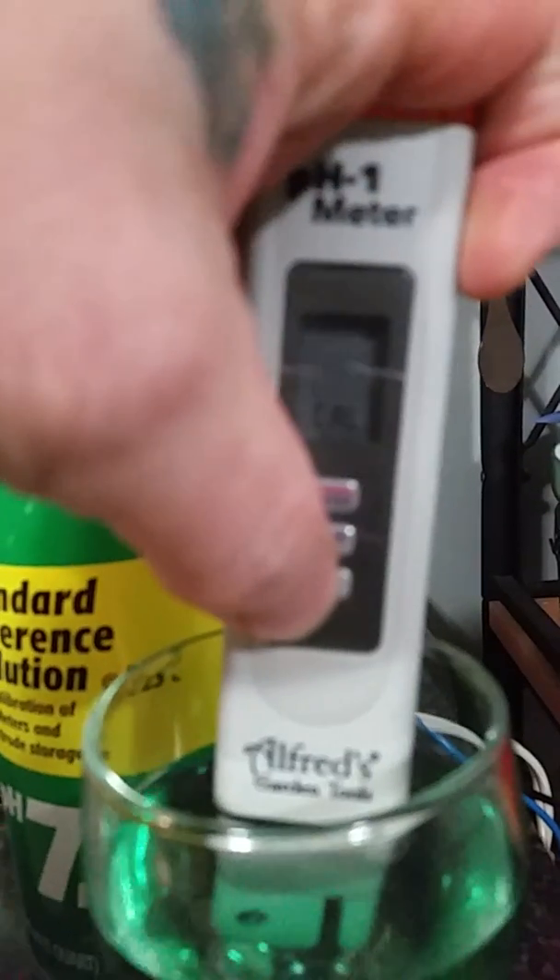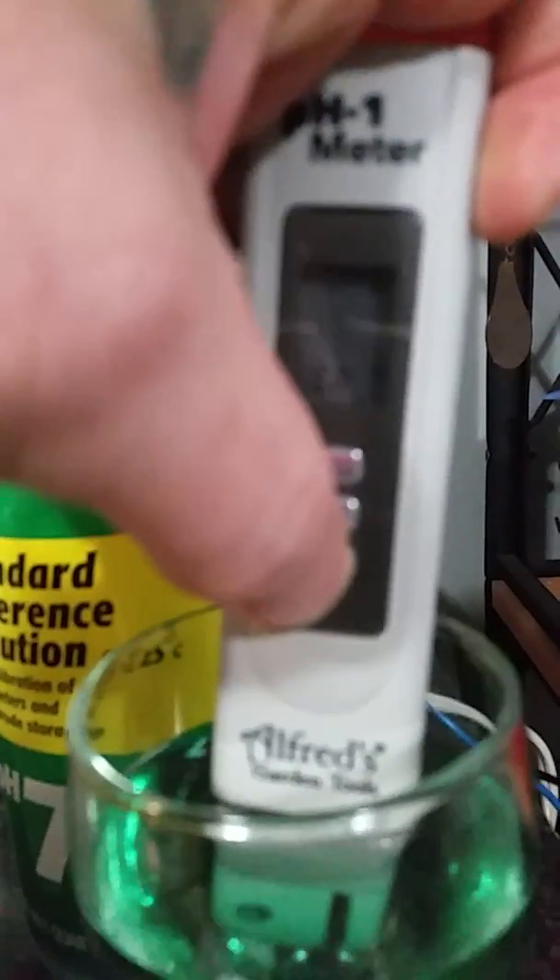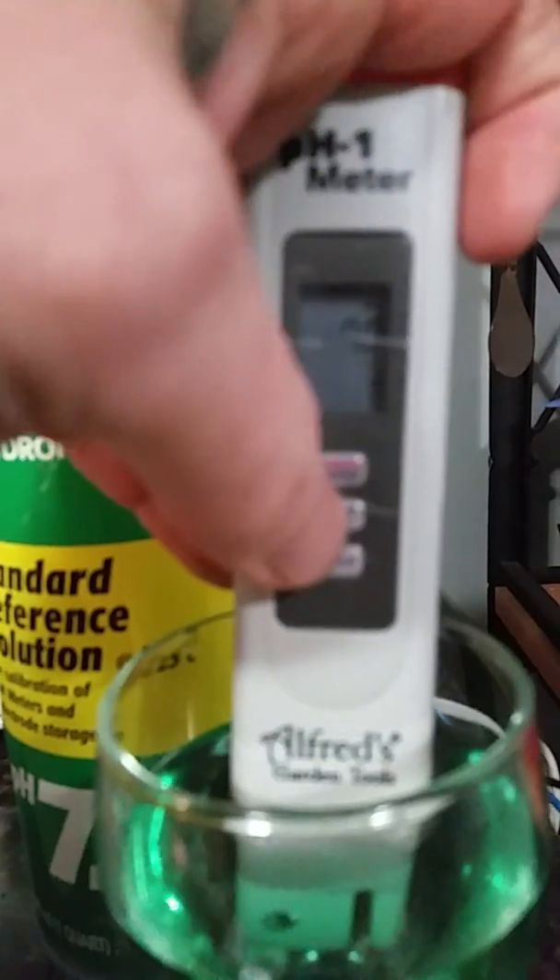You can select down to four or select up.